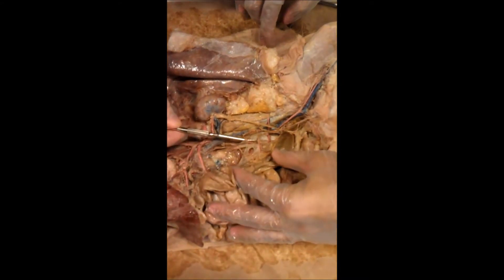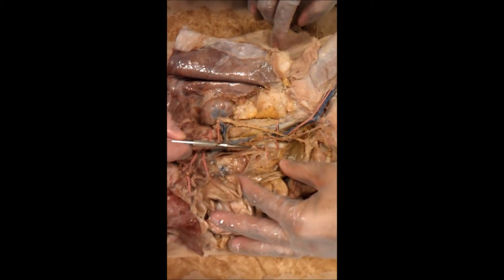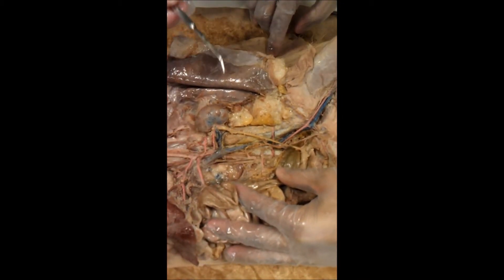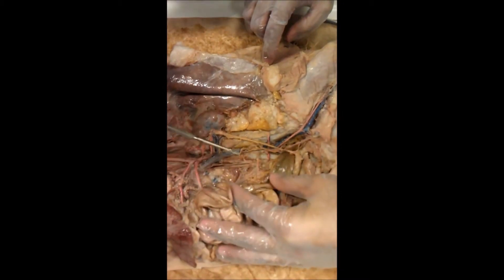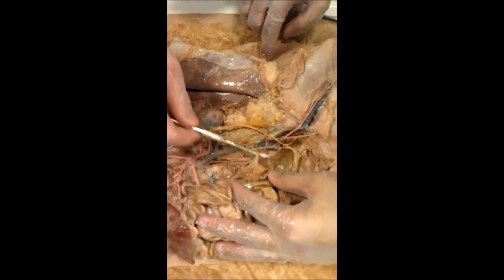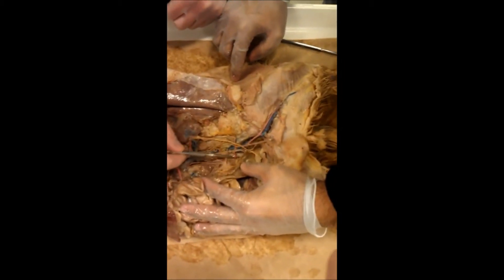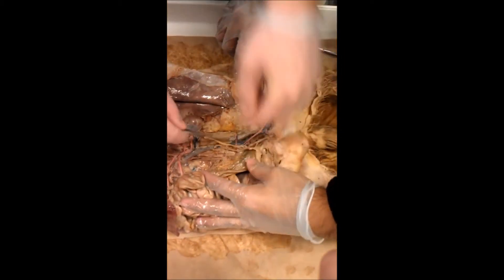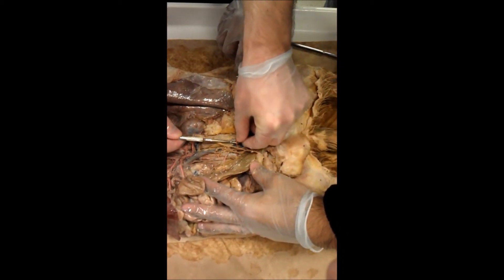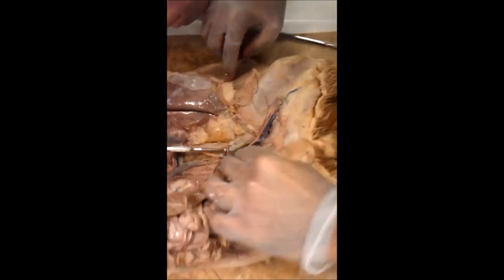This is a male cat. This is a gonadal artery. That's the ureter. This is the inferior mesenteric artery. Here's the right iliolumbar artery. Here's the left — that's the left iliolumbar artery.